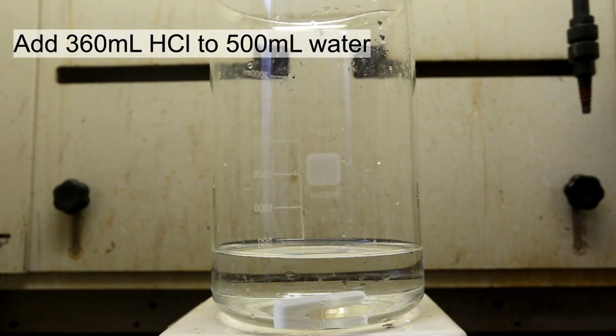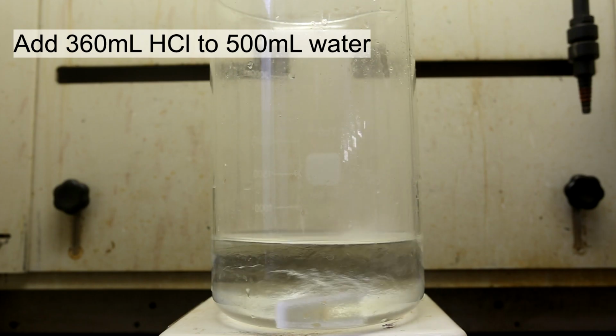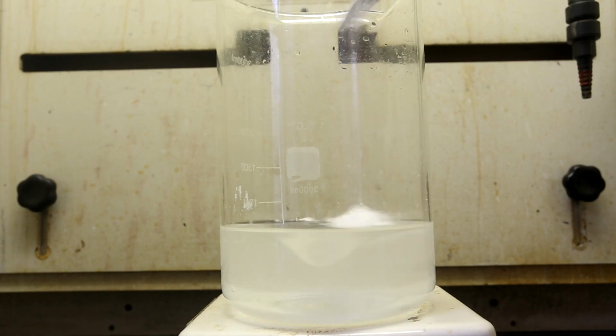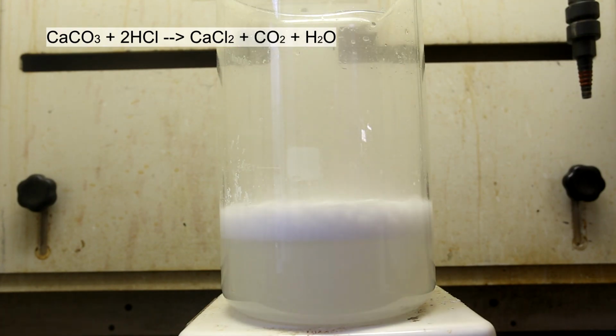Add about 360 milliliters of concentrated hydrochloric acid to about 500 milliliters of water. And weigh out about 200 grams of crushed calcium carbonate. With strong stirring, slowly add the calcium carbonate to the hydrochloric acid solution. The reaction that is occurring is shown above. The calcium carbonate reacts with the hydrochloric acid to form calcium chloride, carbon dioxide, and water.